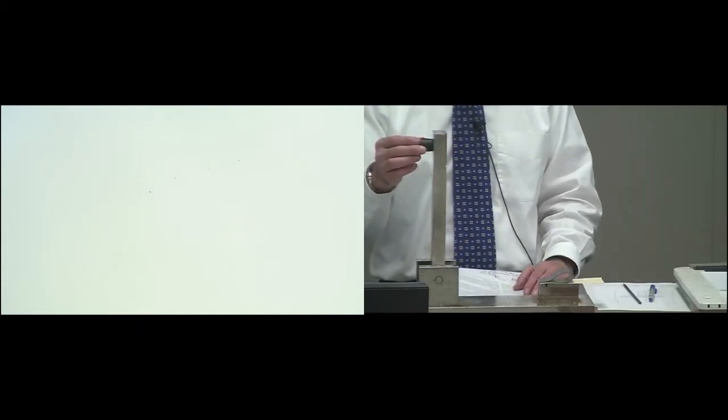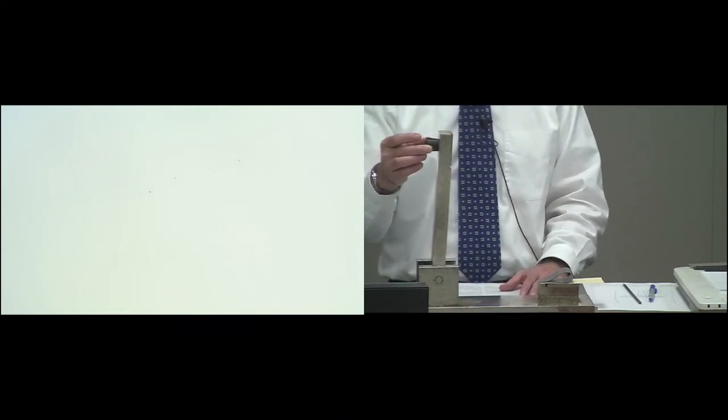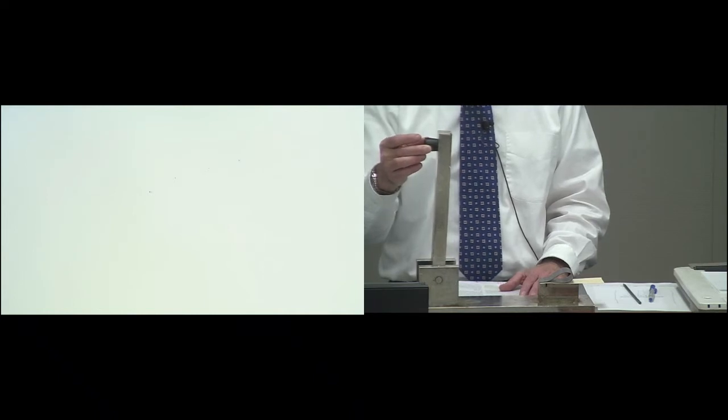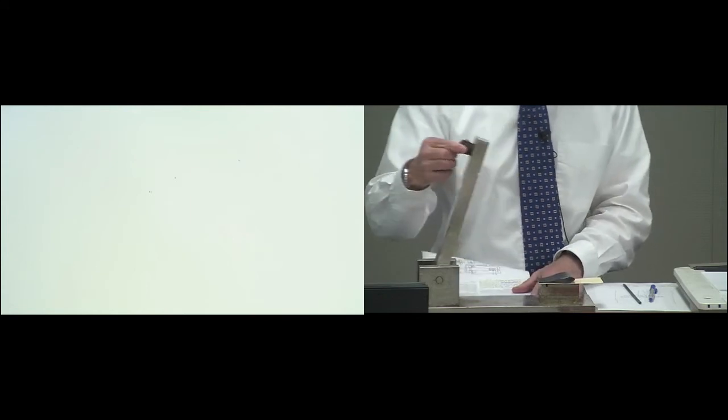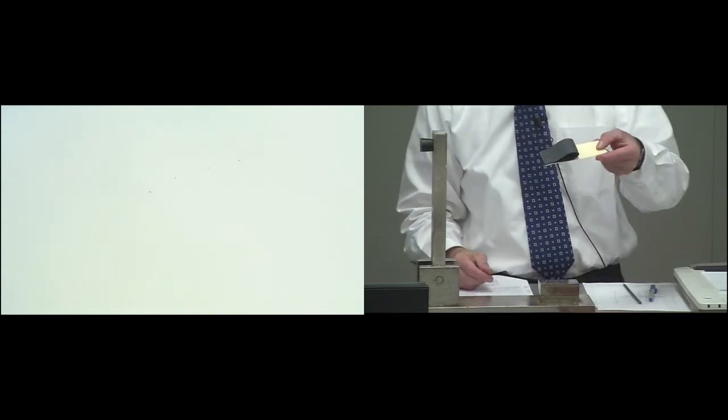In the bottom of the freezer, place the specimen on the impact block, and now I'm going to move the hammer 0 to 5 degrees from vertical so it falls on the geomembrane specimen that has been subjected to minus 29 degrees Celsius for 15 minutes. So here goes the hammer. The hammer is lifted back up to vertical, and the specimen is pulled out after the test.